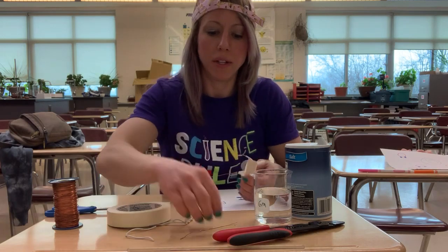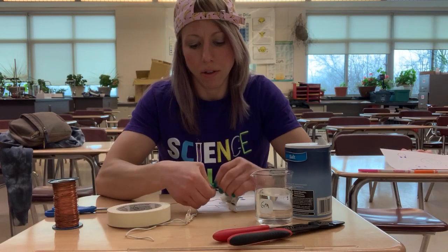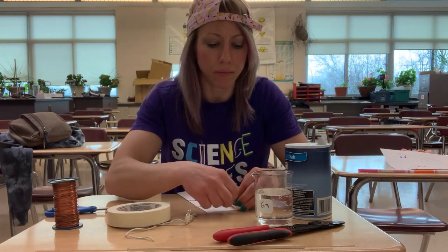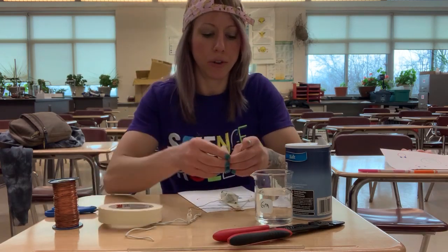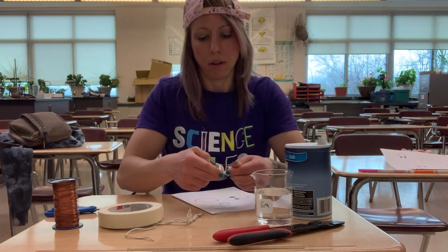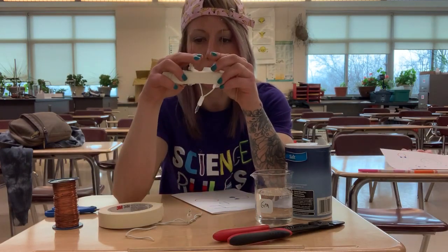Okay, and then I'm going to take my other piece of copper wire and loop the other end. You could actually just use the exposed wire from the Christmas light for this part, but just so that it has two distinct prongs for you to stick in the solution. And you can test if they're going to work by touching them together. So this is functional. Yay.